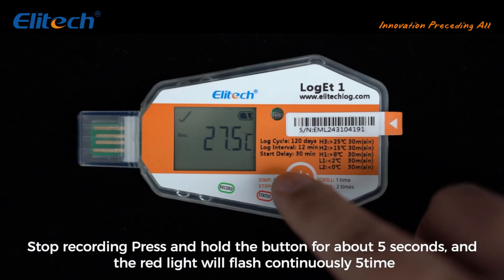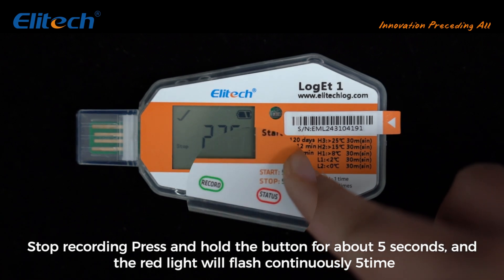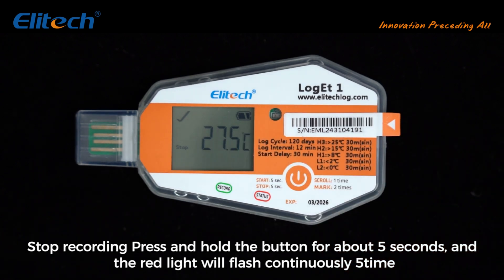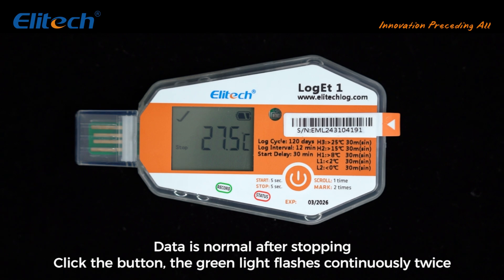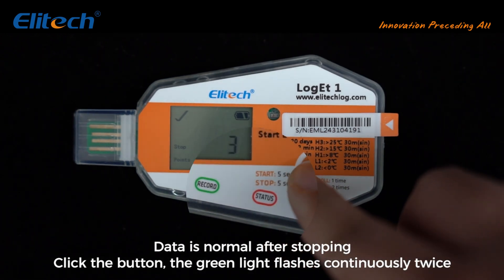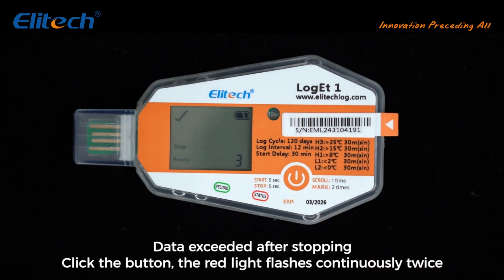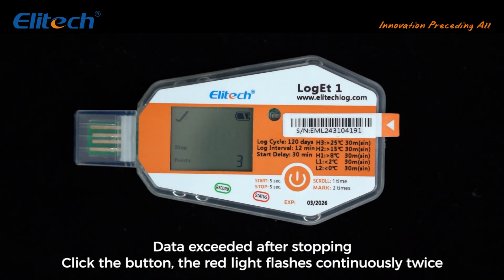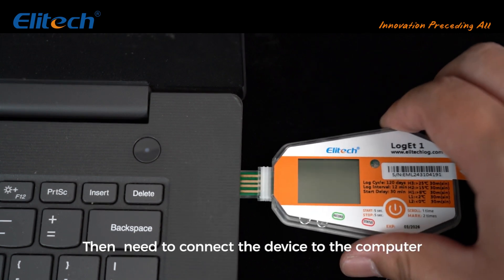To stop recording, press and hold the button for about five seconds — the red light will flash continuously five times. After stopping, if data is normal, click the button and the green light flashes continuously twice. If data exceeded, click the button and the red light flashes continuously twice. Then connect the device to the computer.